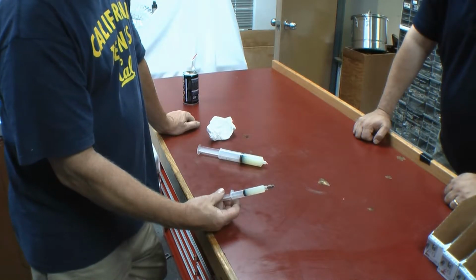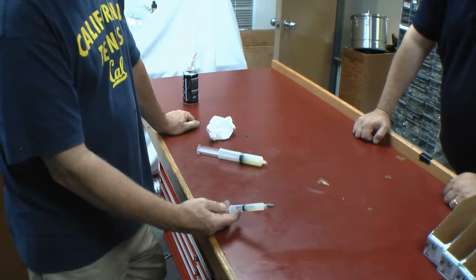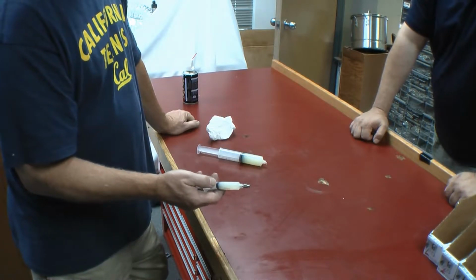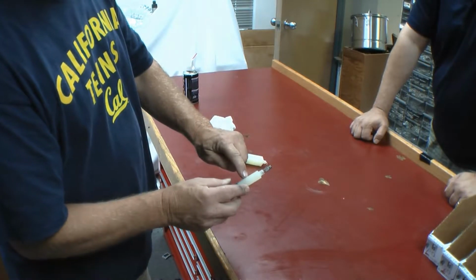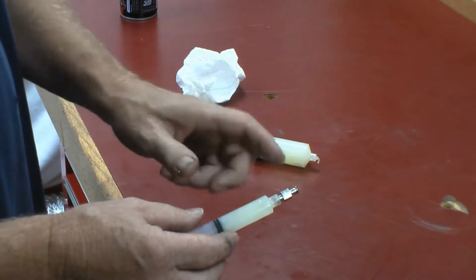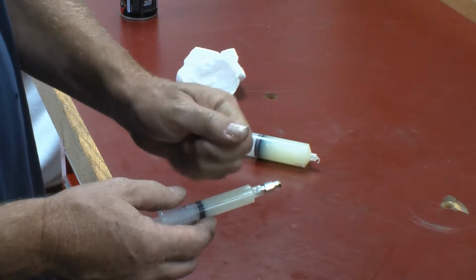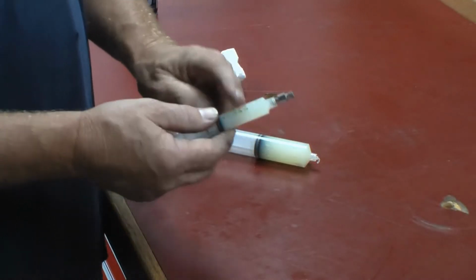One of the common problems that we run into is how to load the material. I mean, it seems silly that you would say, oh, I got to load the material, that's easy. But what happens is, using different techniques, you can indeed get lots of little bubbles inside of here. And the problem with that is the bubbles are very compressible compared to the liquid or the other material that we have in here. So when you do your prime and unprime, we just squeeze the air. We don't actually displace the liquid. So you really want no bubbles in here.